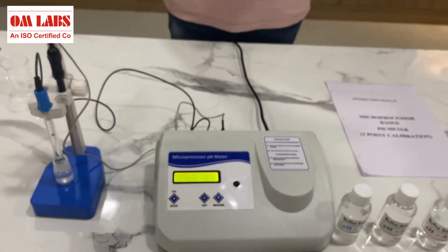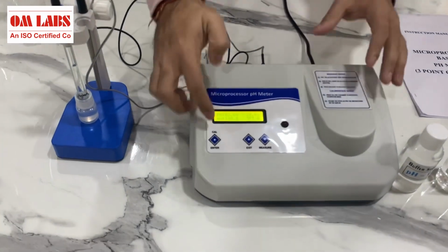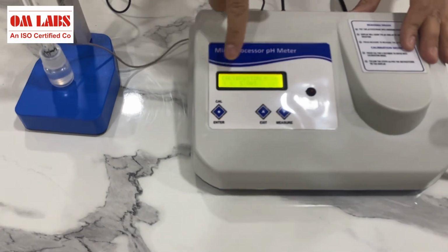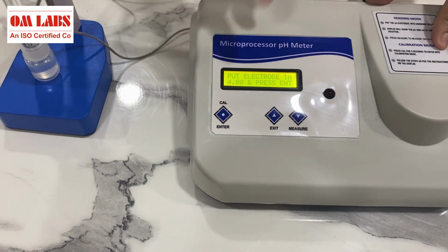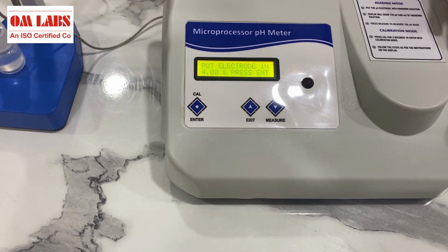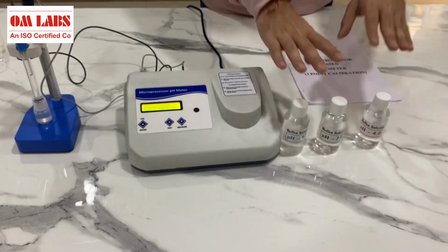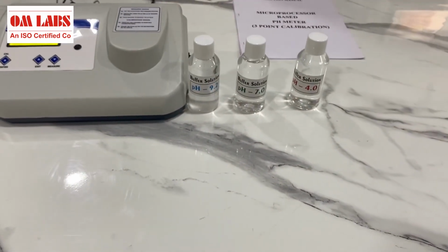But again, for your reference, I will calibrate it so that you will know its operation, and you will be able to calibrate this pH meter by referring to this video. Say, for example, I want to calibrate it. I'll press on cal and the calibration mode has started. Now it is asking me to put the electrode in 4 pH solution, or the 4 buffer. Here with this pH meter, we also provide you with 3 solutions which are meant for calibration.